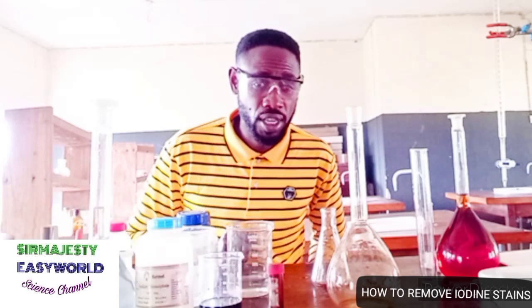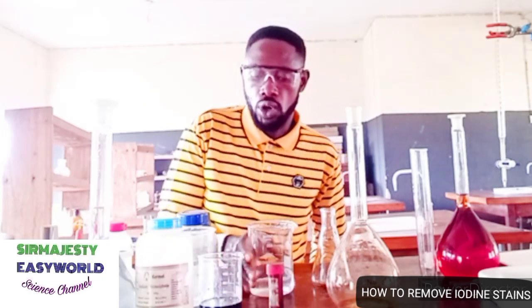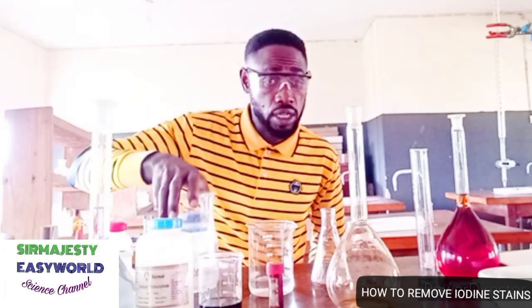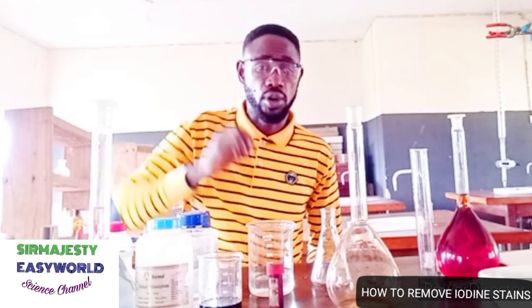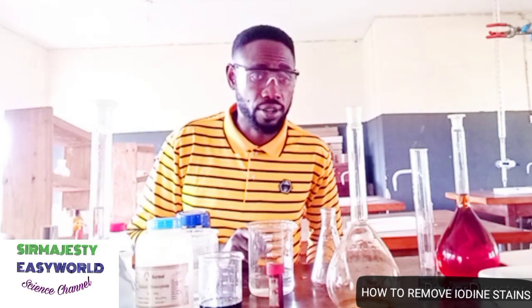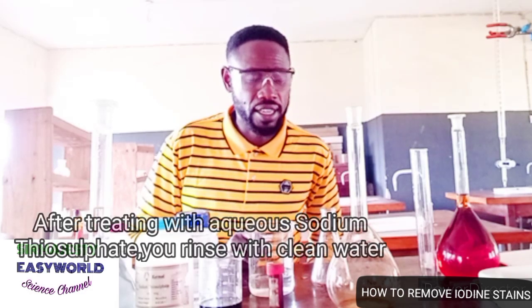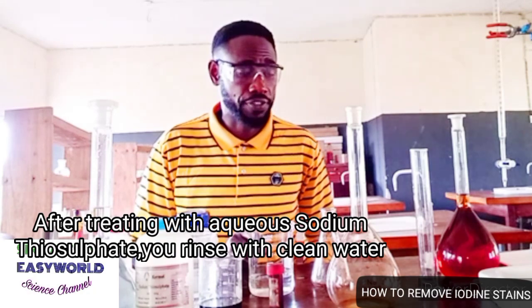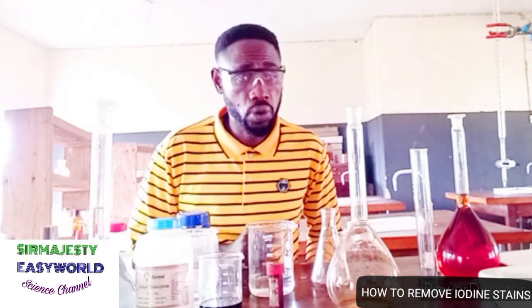What did I say? You use an aqueous solution of sodium thiosulfate, which is here, or you use an aqueous solution of sodium hydroxide or potassium hydroxide. Whenever you drop it on any iodine stain, it takes it away by dissolving the iodine crystal back to iodide ion. It reduces the elemental iodine to iodide ion, and that is soluble. When it takes it down to the iodide, you pour water, and the stain goes.